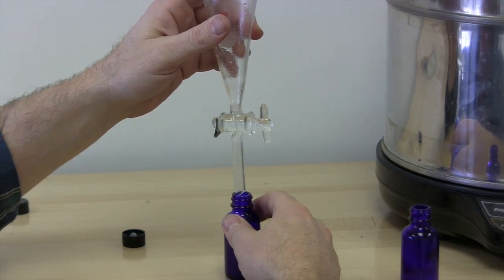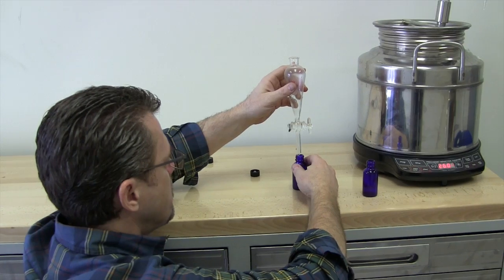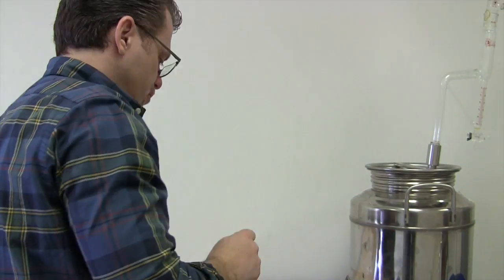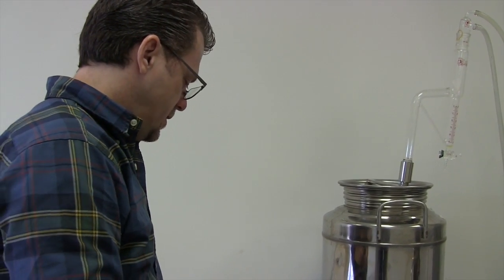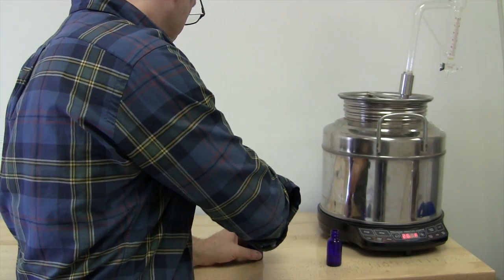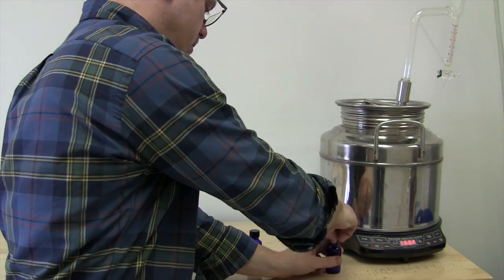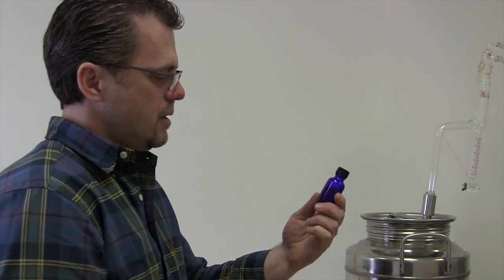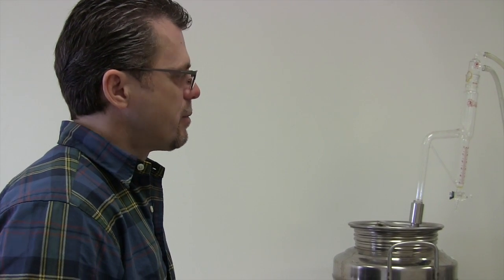And now I'm going to save the oil in a separate bottle. The water, the oil looks a little cloudy, and it always does when it's first distilled. That will clear up over time as the micro droplets of water are pulled out and adhered to the glass, because glass is a very good absorber of water. So by tomorrow, if I poured this oil out, it would be completely transparent. So we'll just let that distill a little longer and then see how much more we get.